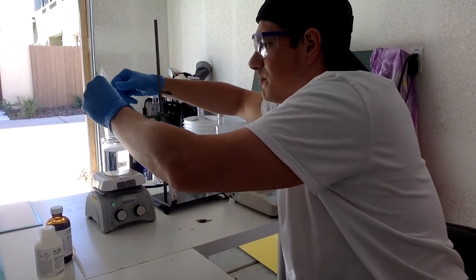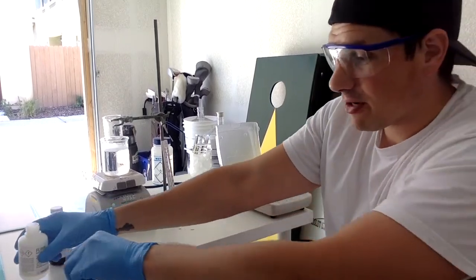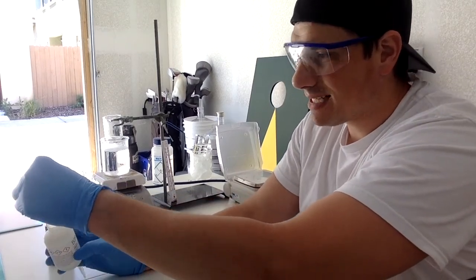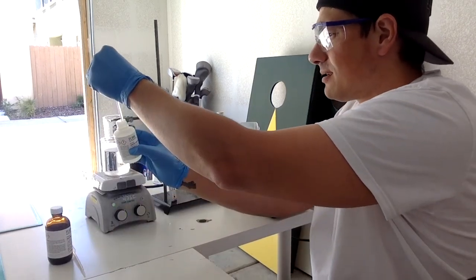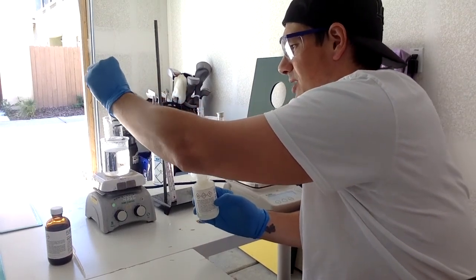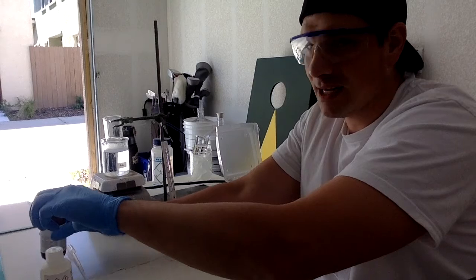Okay, so let's add this pre-aspirin to our beaker right here. Then it calls for 1 milliliter of acetic anhydride. Now, acetic anhydride, you want to use in a ventilated area, ventilated garage. It's called a lacrimator. What it does is it makes you cry. If I were to smell the fumes of this, generally it makes me start crying. Kind of weird, huh? You'll get super, super crazy tears, stuff like that.